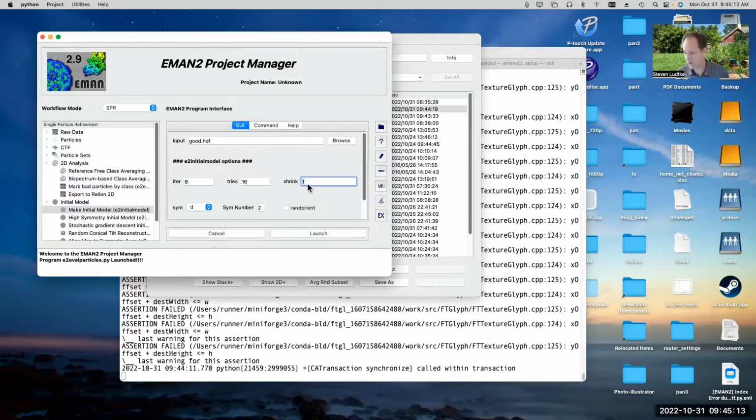If you used the 256 by 256 particles, then maybe you'd want to reduce those down by a factor of 3 or a factor of 4 or something, just to make this initial model generation run faster. And it'll run a lot faster if you reduce the particle size. Generally speaking, the scaling with box size in most of the operations in most single particle packages scales as the box size cubed or worse in many cases. So you can get a tremendous amount of advantage if you downsample your data in terms of speed. Eventually, you're going to have to go back to the original data if you want to get the maximum quality out, but you can save that for your final refinements.